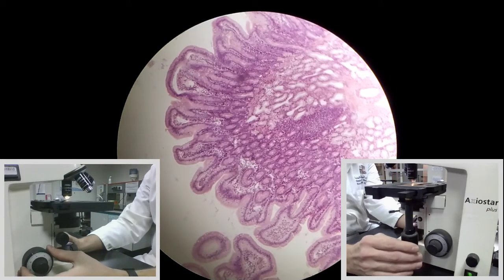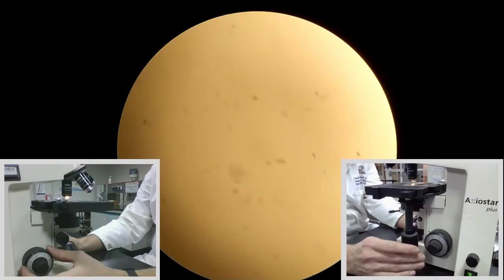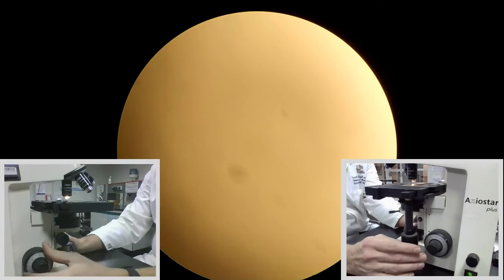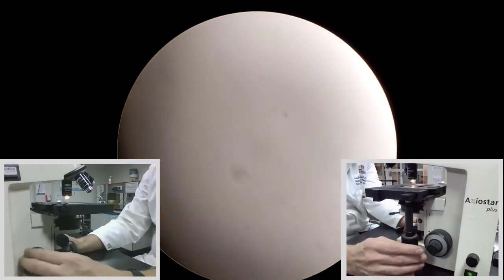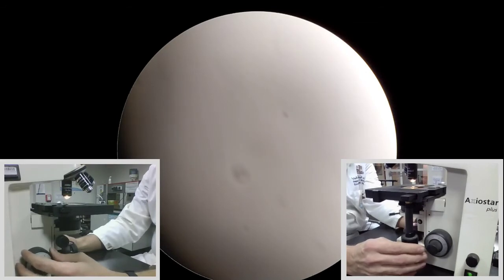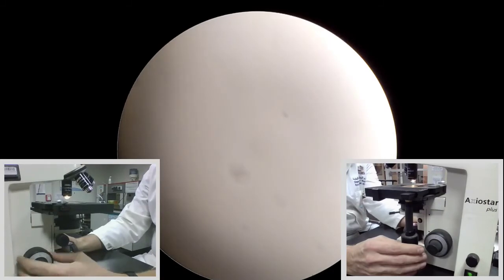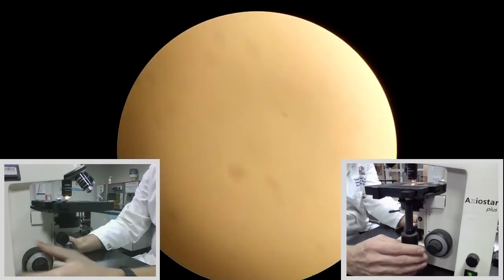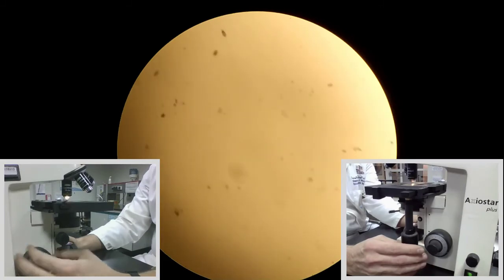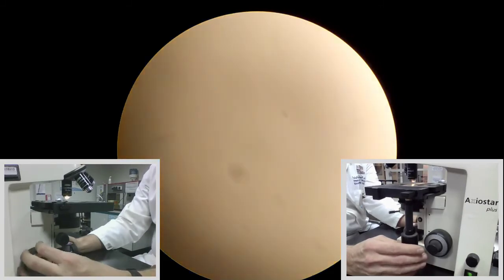Now, what happens if you are on a slide that doesn't seem to have anything on it, and you're having a really hard time focusing on it? Your slide isn't really centered properly, so you really can't tell where your sample is. If I bring this all the way up now, all I see is just a bit of dirt at different levels — so what do I do?